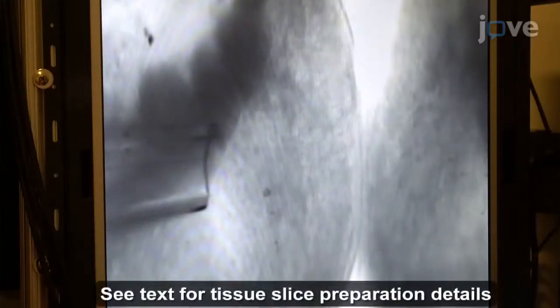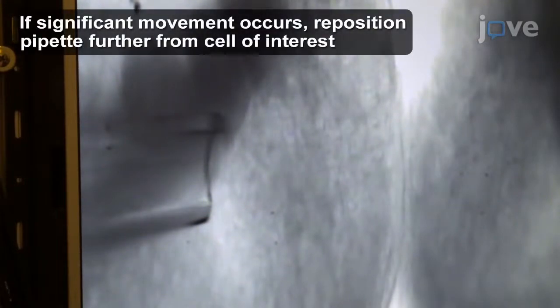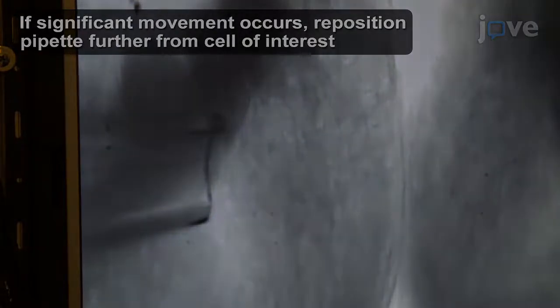Position the pipette tip slightly above a mouse brain tissue sample approximately 50 micrometers from the cell of interest, and briefly apply 1 to 2 pounds per square inch of pressure to the pipette. There should be minimal to no displacement of the cell of interest.